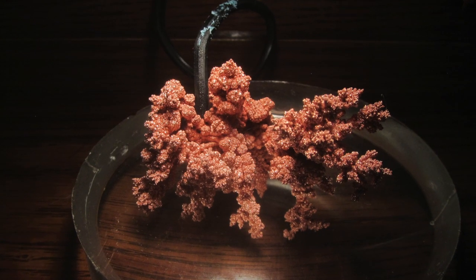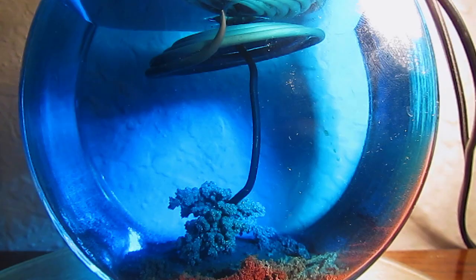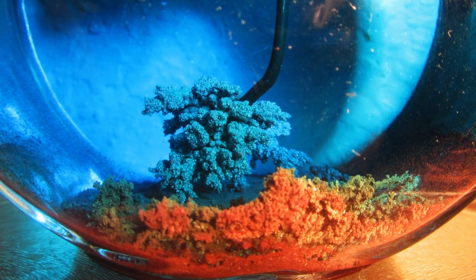This is a beautiful crystal, but I wanted to try something else. I reversed the cell so the crystal was on bottom and the coil was on top.